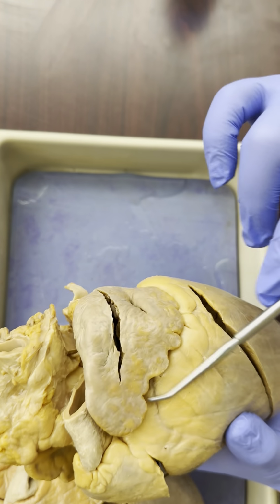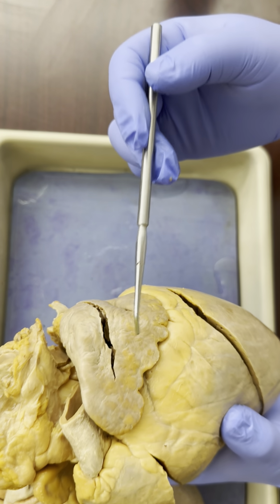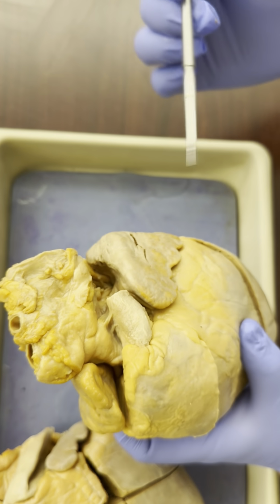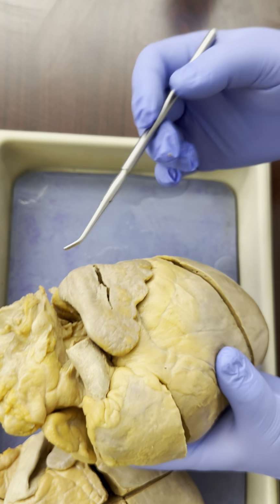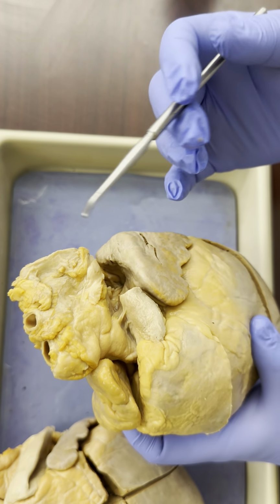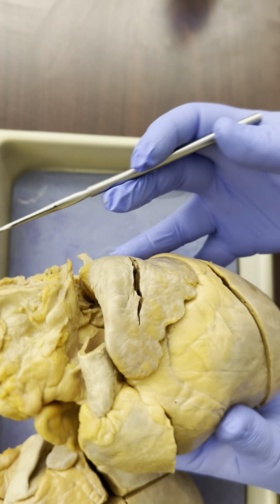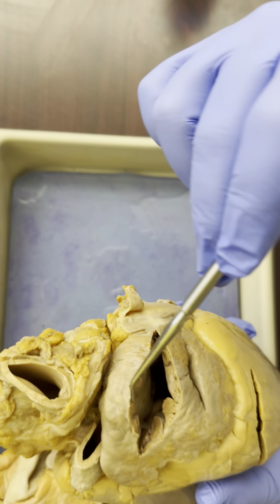These are different colors. That's not always the case, so don't pay any attention to the colors. But we have the left and the right auricle. Now, most of the time, you do not need to know the auricles on the actual hearts. You do on the models, but on the actual hearts, you don't. What you do need to know, though, is what is inside those auricles.